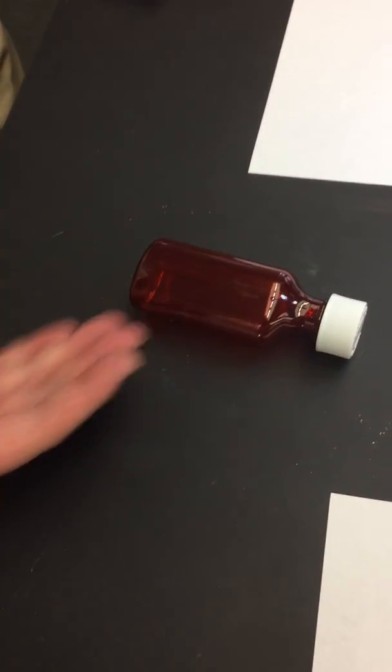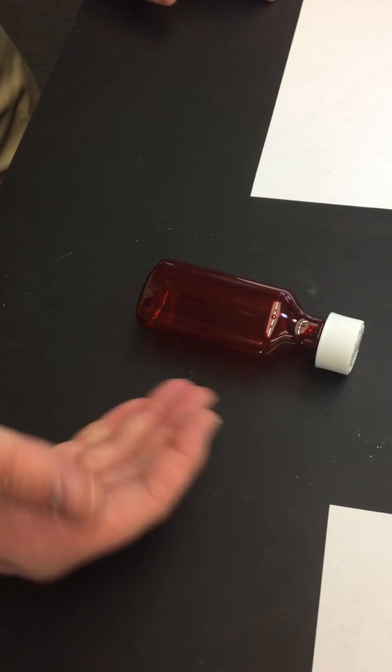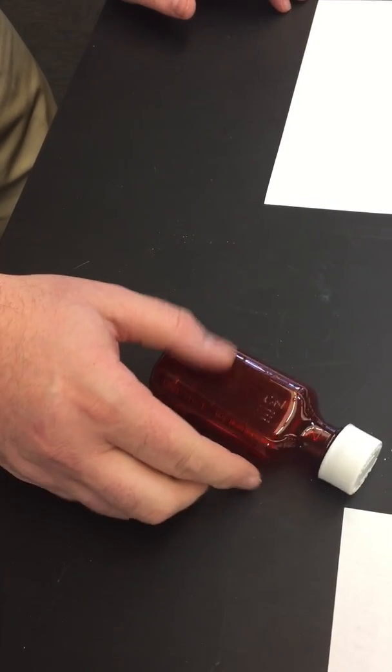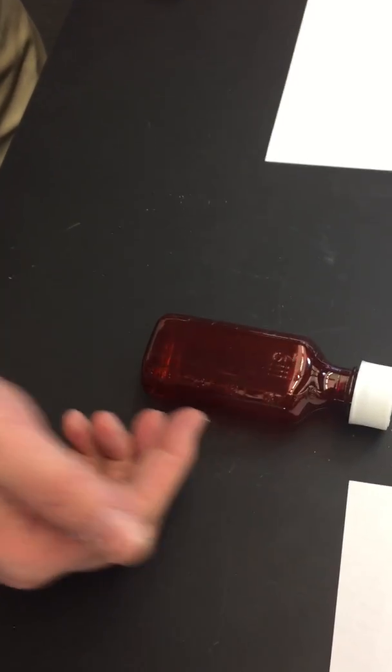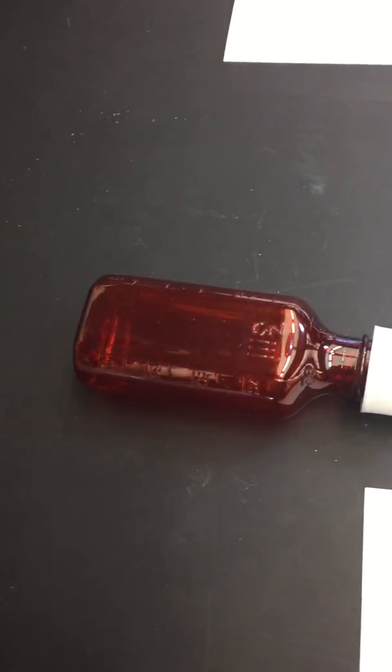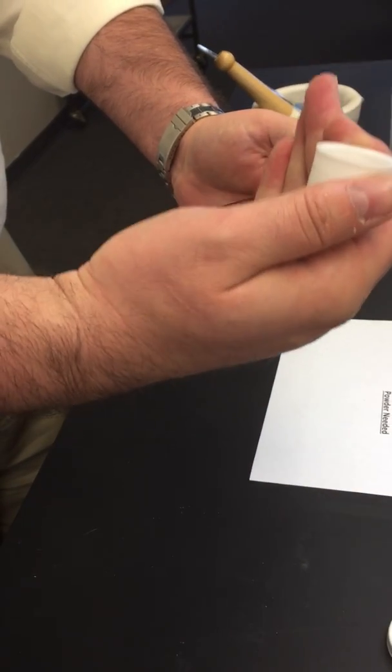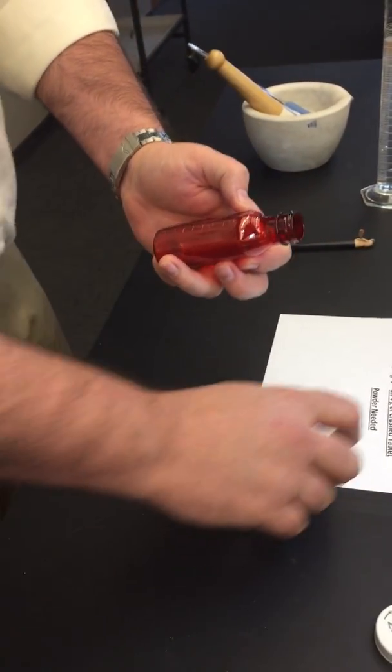When you're working with amber vials of any size, whether it's 2 through a 16-ounce vial, these are mass produced, so the markings on the side, even though they're marked as 60 mLs, 30 mLs, whatever the case might be, they're not going to be accurate because they're not calibrated. So anytime you're compounding, you never want to QS up in your amber vial. You always want to calibrate it first.